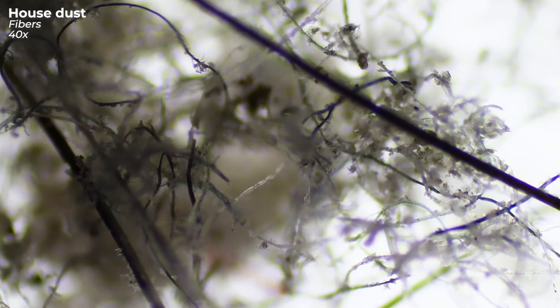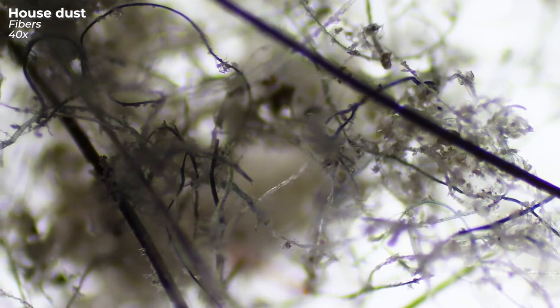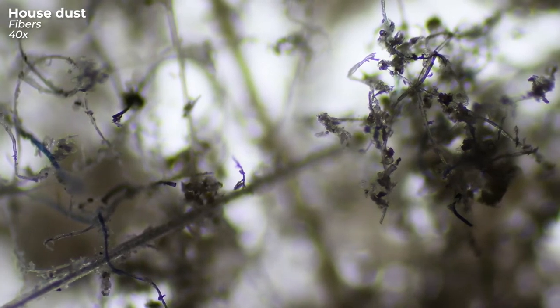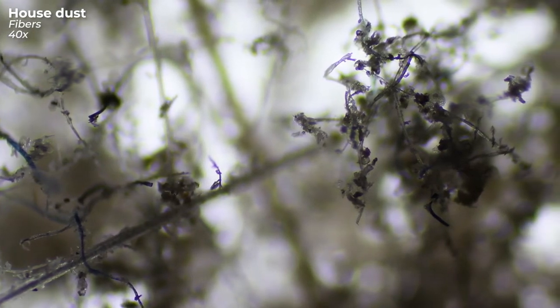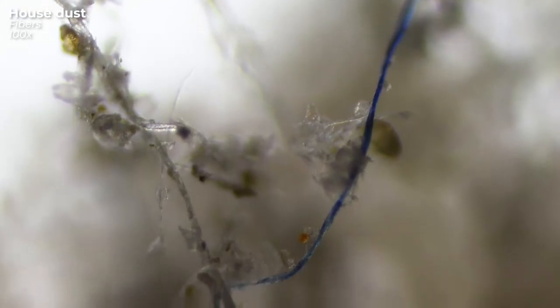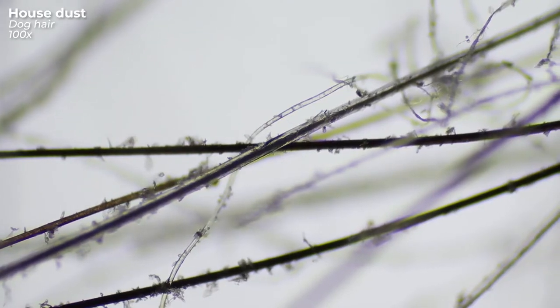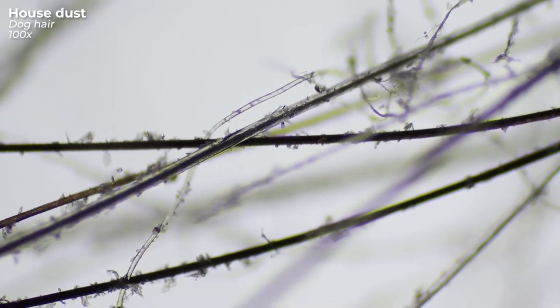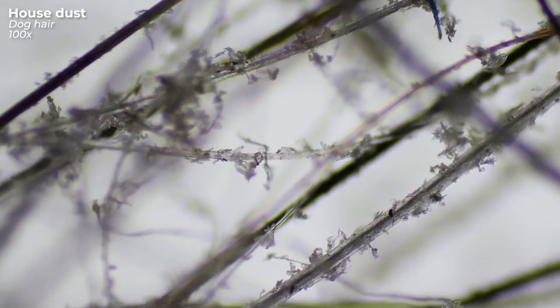Next we'll take a look at a few of these fibers. Some of them are certainly from my clothes, carpets, and also from my upholstered furniture. But the biggest share comes from — who would have thought it — my best but also extremely hairy friend. It seems that his second favorite activity is to spread his fur everywhere, because this is all dog hair.